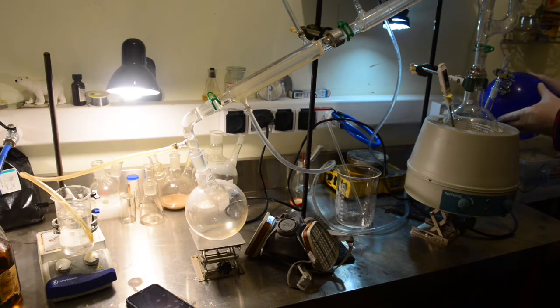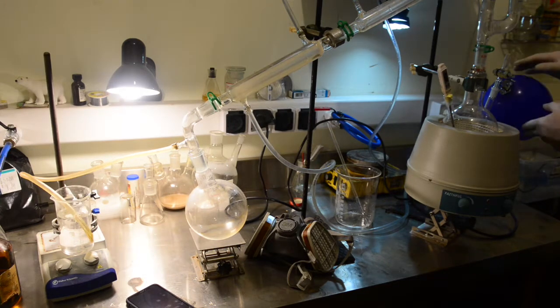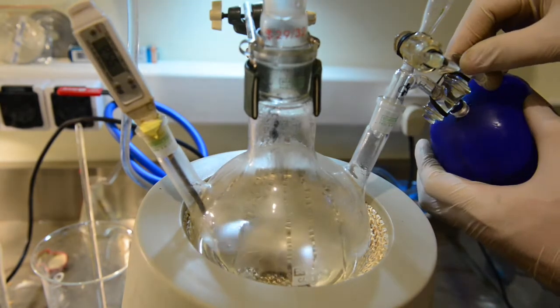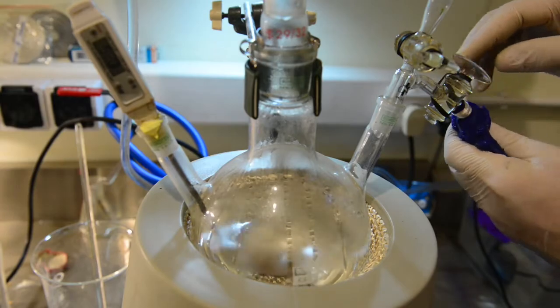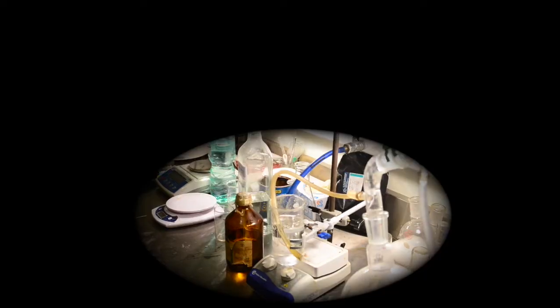In the video, I have a little helium saved in the balloon just in case, but it is not necessary. I have realized it later on and squeezed the leftover of helium into the apparatus. Start the stirrer, set the heating to the maximum and let the show begin.